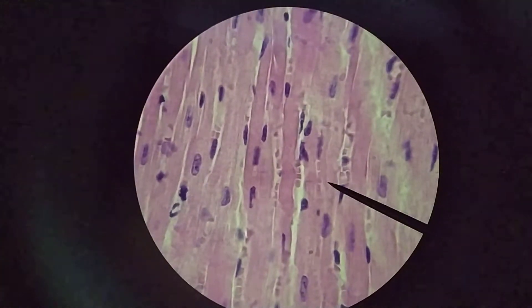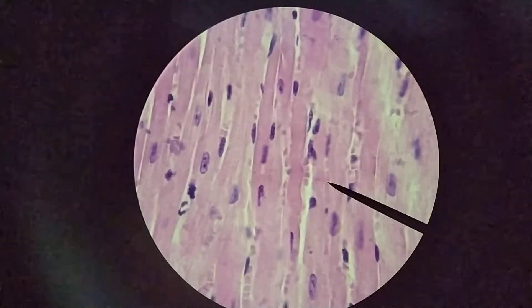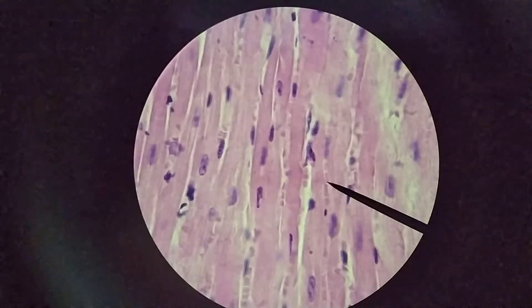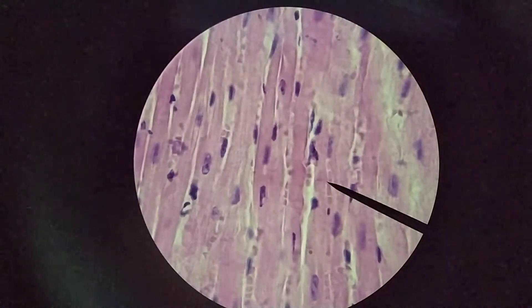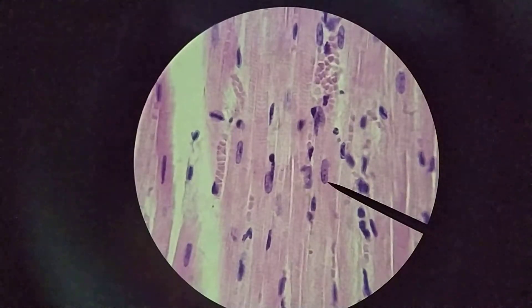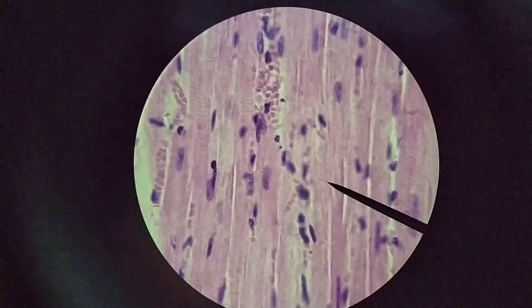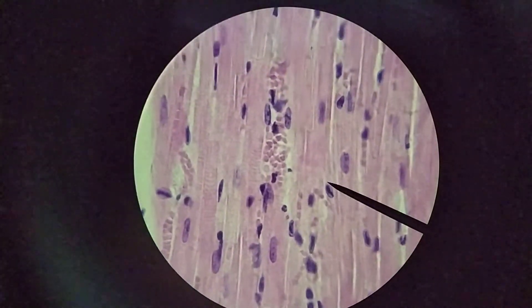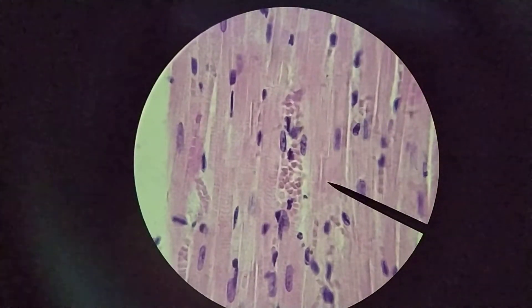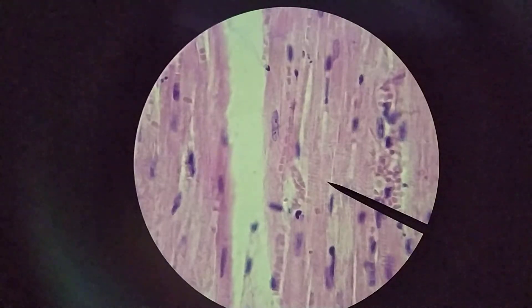If you know what you're looking for, you can kind of make it out. Now, this is a striated kind of muscle, but you don't really see the striations here. Part of that reason is that the myofibrils are separated from one another by lots and lots of mitochondria. Because they're not as tightly packed, it's a little bit more difficult to see the striations. I can kind of make them out here, but they're not quite as obvious as they are in skeletal muscle.